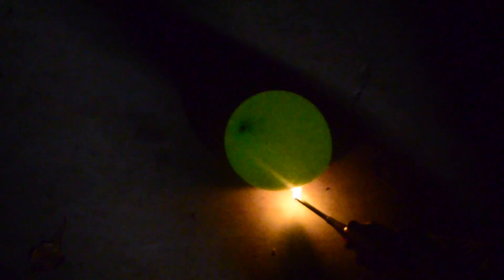While looking at what just happened, that was a bit smaller than I was hoping for. What I think actually happened is that when the balloon popped, most of the hydrogen dispersed out before it combusted. So now I'm going to go ahead and try it again when it gets darker with a new balloon. That last one didn't turn out quite as well either, so I think I'm going to try it one more time with another balloon.